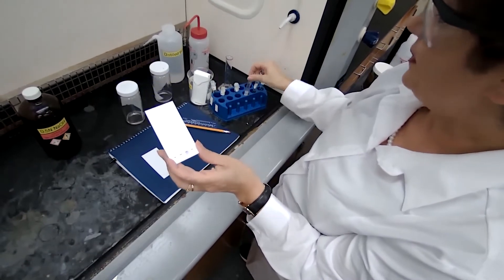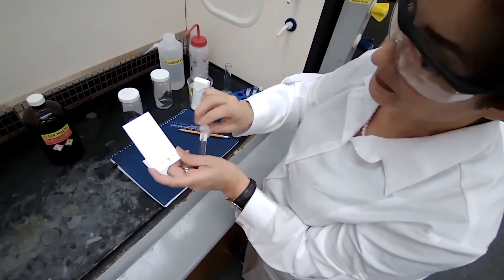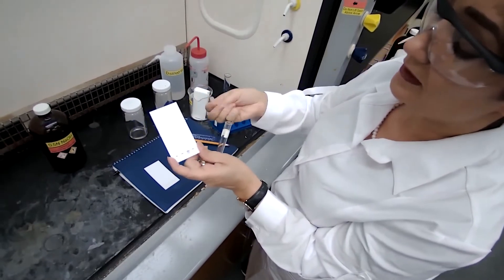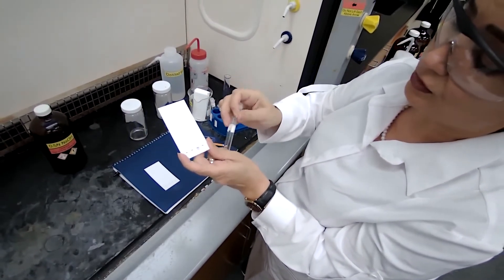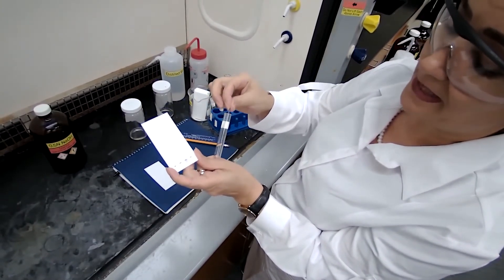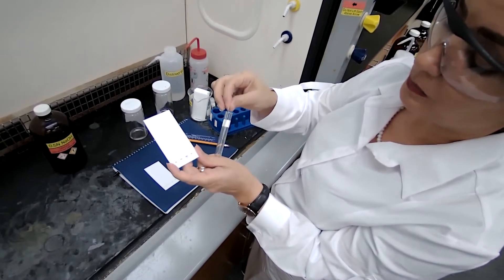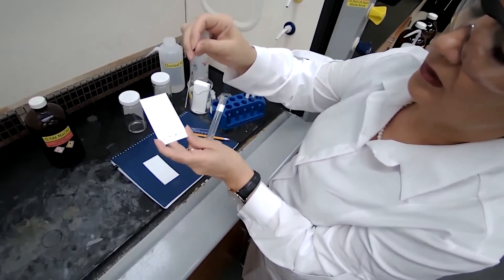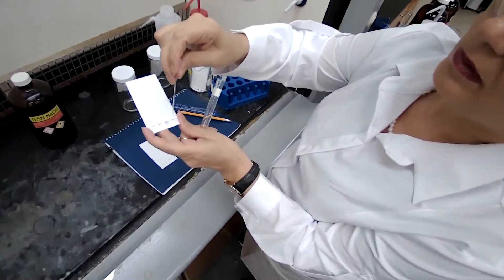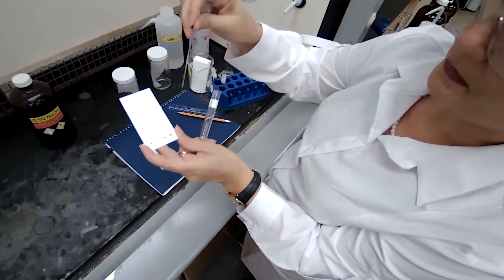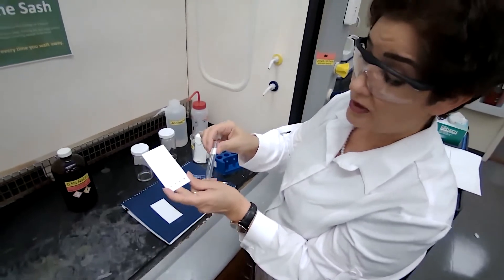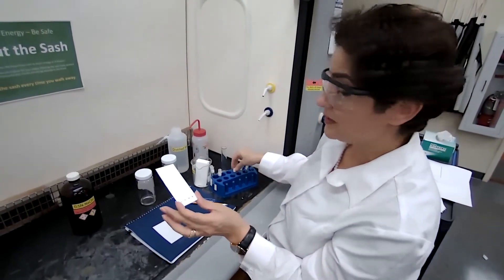You can practice this using like a filter paper, or if one of the samples gets like too large of a spot, you can always make a second plate. That's why I kind of have a second plate here.